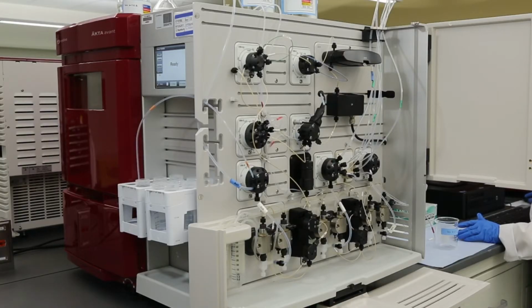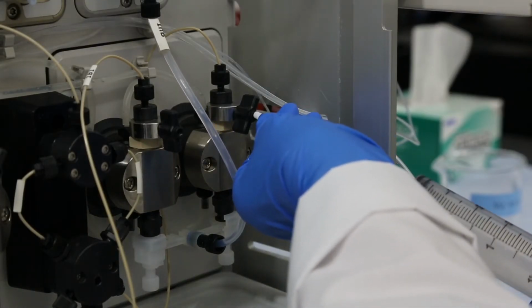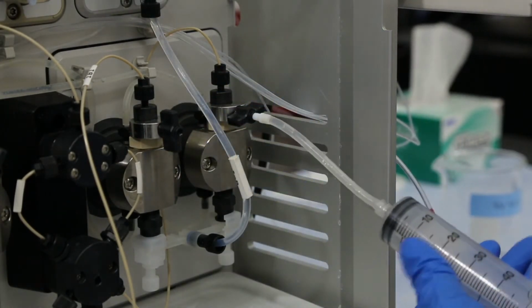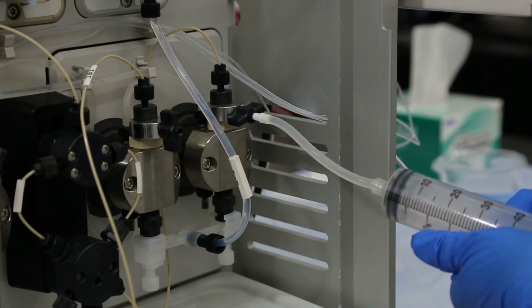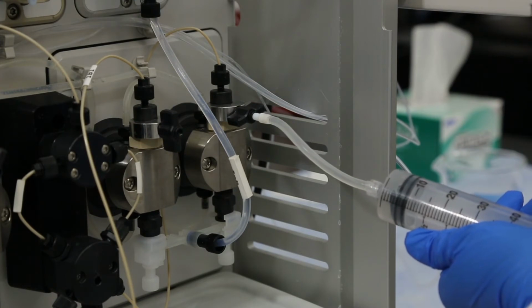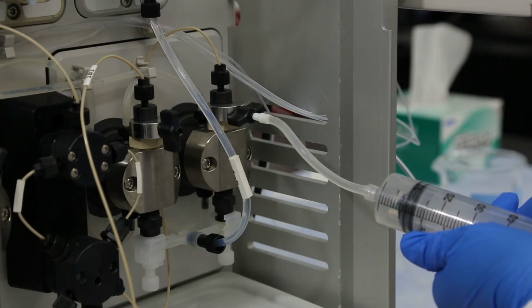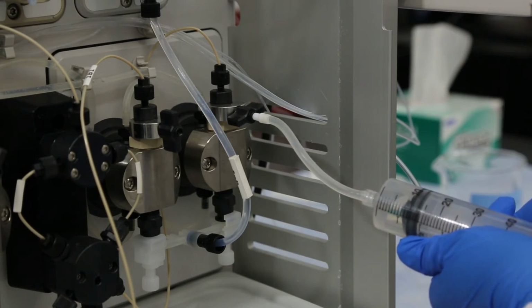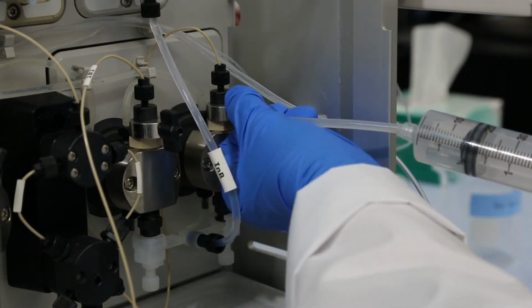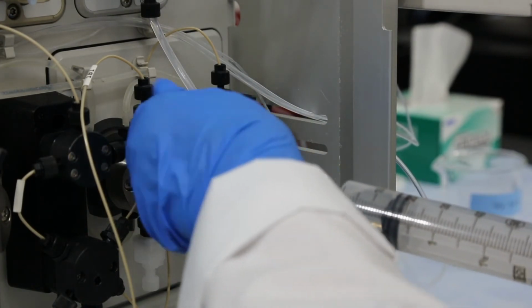Attach a syringe and purge tubing to the purge valve on one of the pump heads for the pump you are priming. Open the purge valve approximately one full turn and gently draw back on the syringe. If you were unable to pull any buffer through, continue opening the purge valve until buffer begins to flow into the syringe. Continue drawing buffer into the syringe until you have removed all air bubbles. Close the purge valve, remove the syringe, and repeat the process on the other pump head.